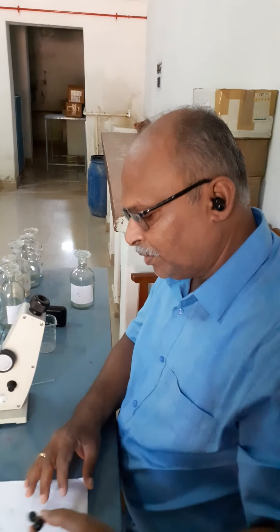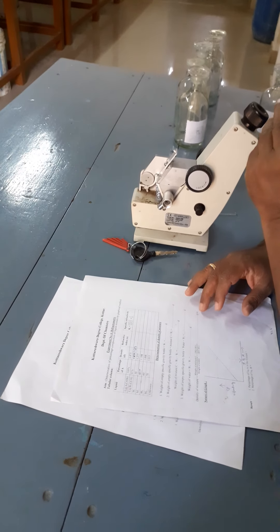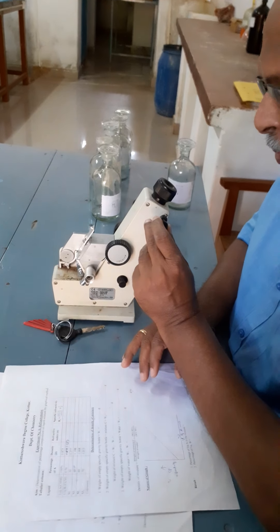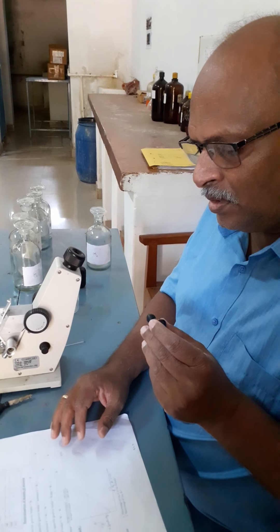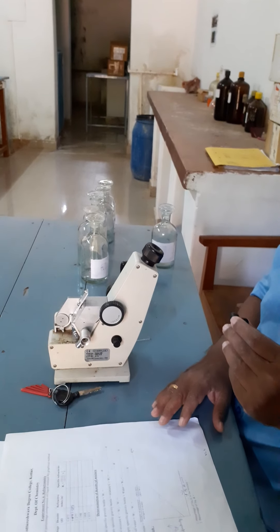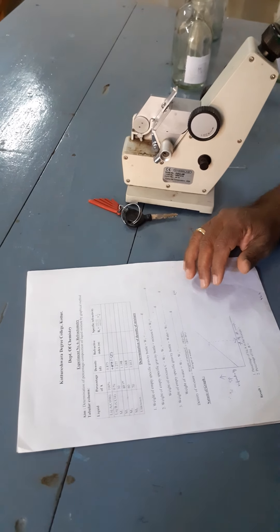Hello, good morning friends. In yesterday's class I explained how to determine the percentage composition of an unknown liquid mixture using a refractometer with the formula method. Today I would like to explain how to determine the percentage composition of a liquid mixture using the same refractometer with the help of a graph.